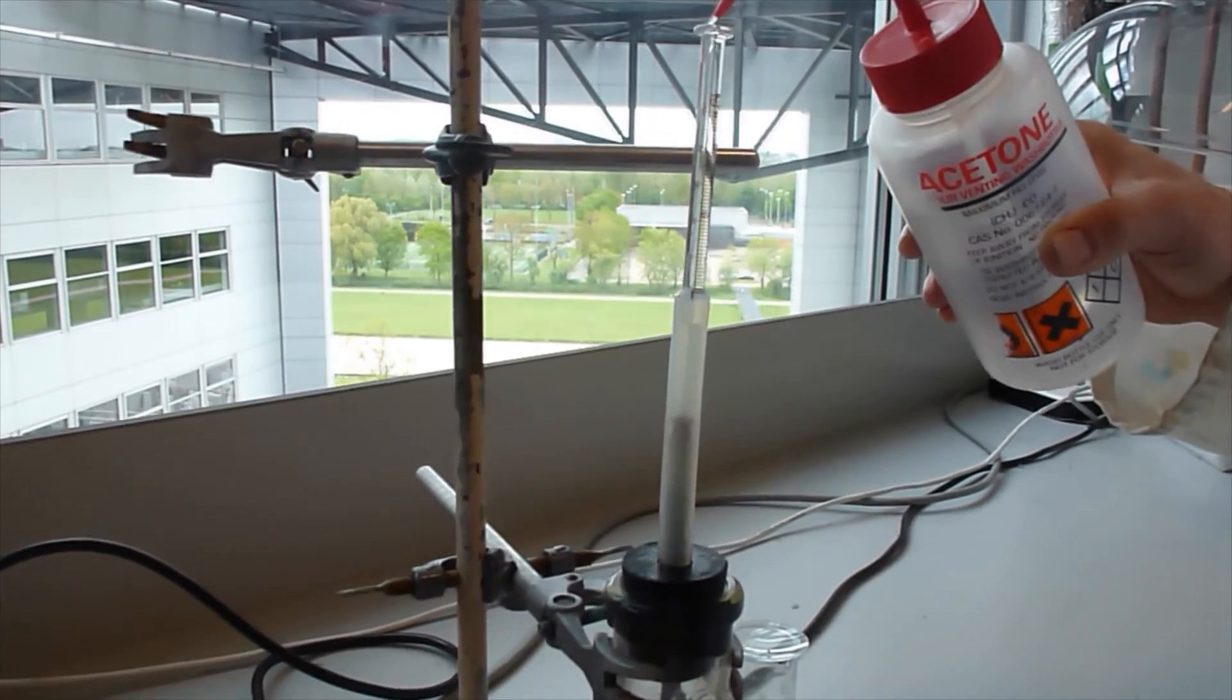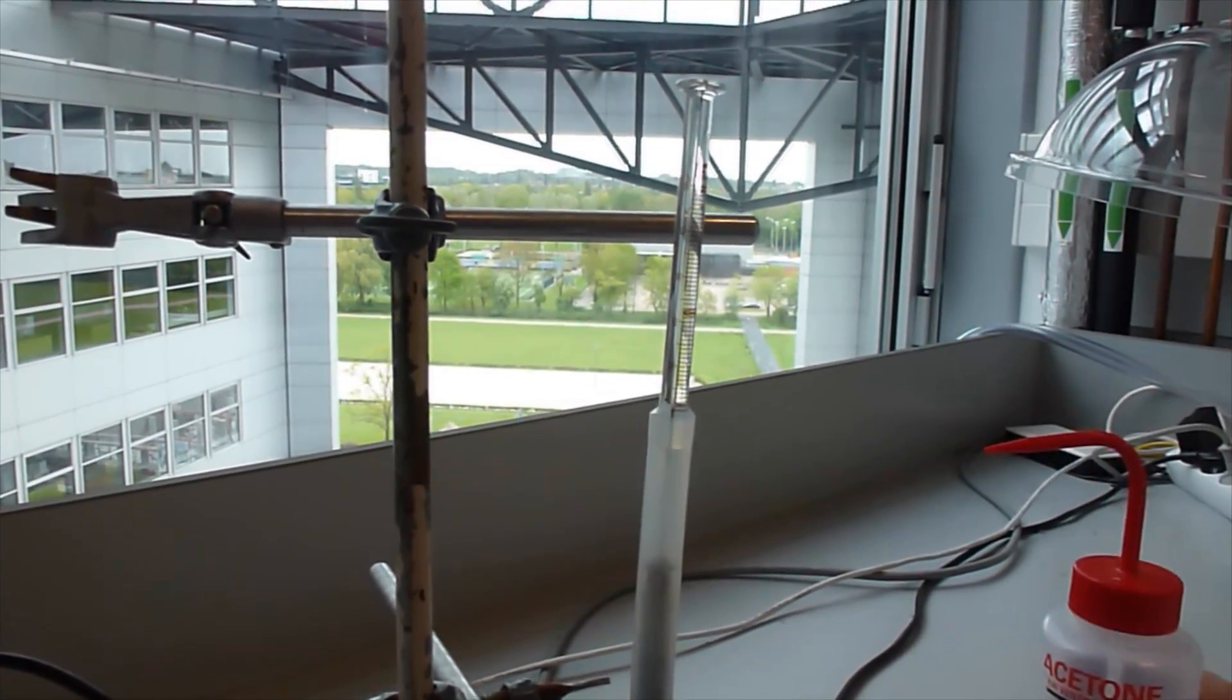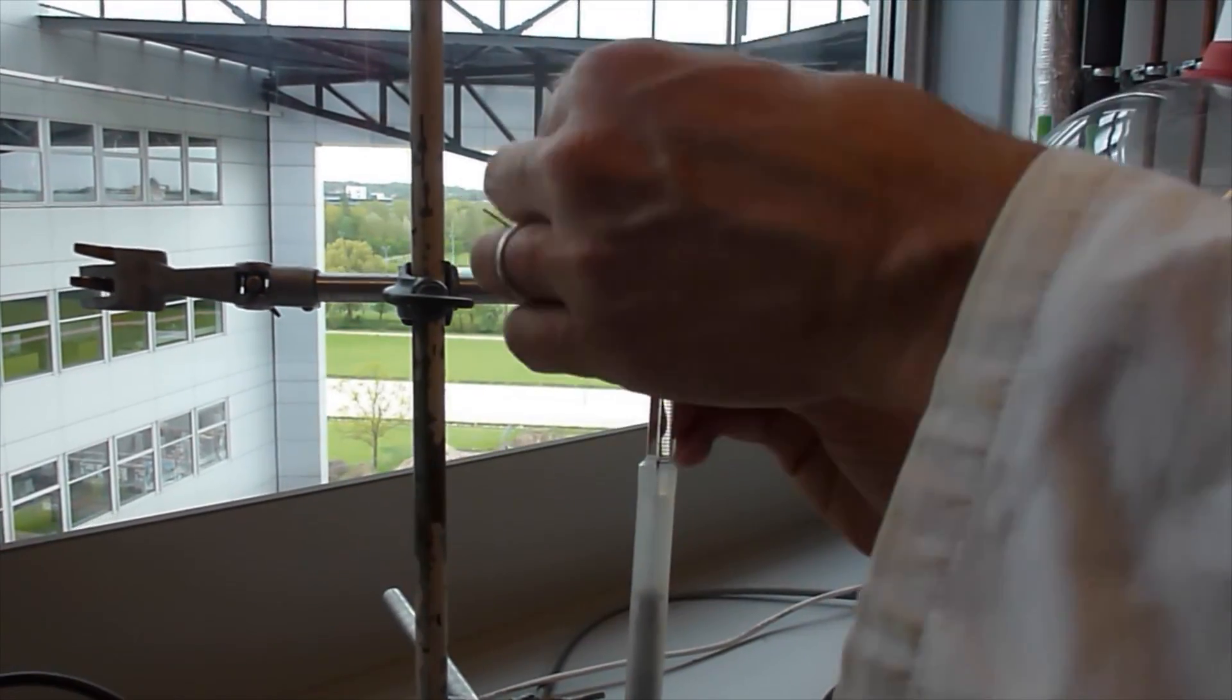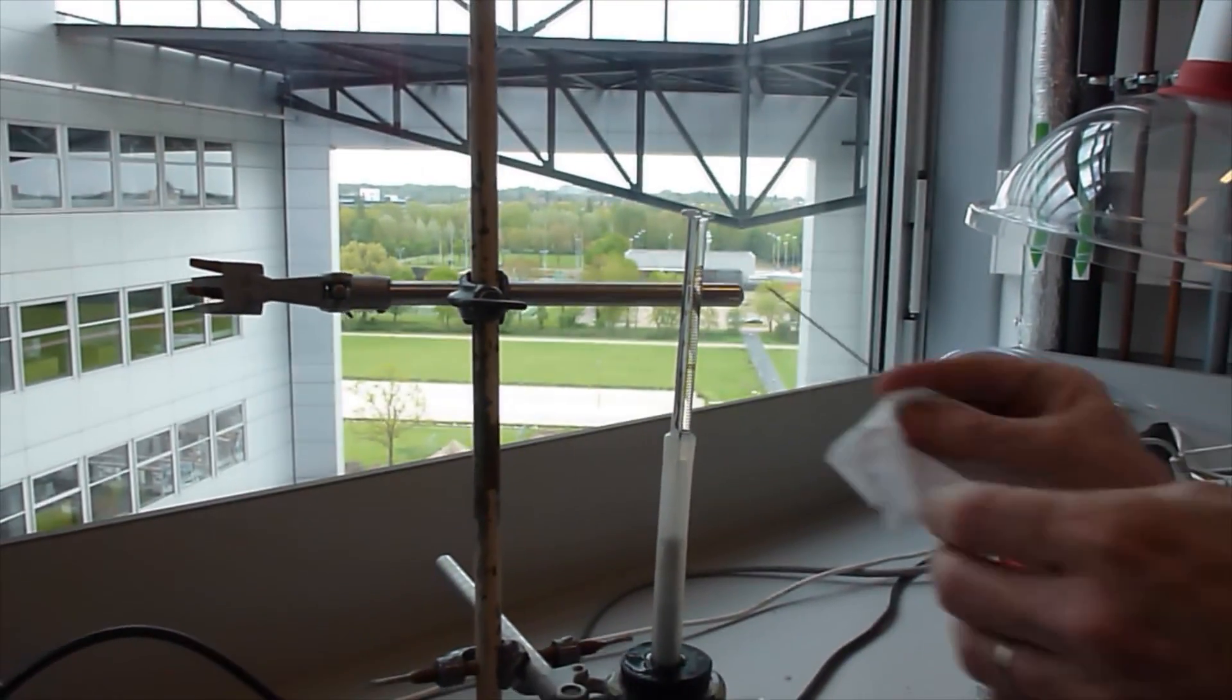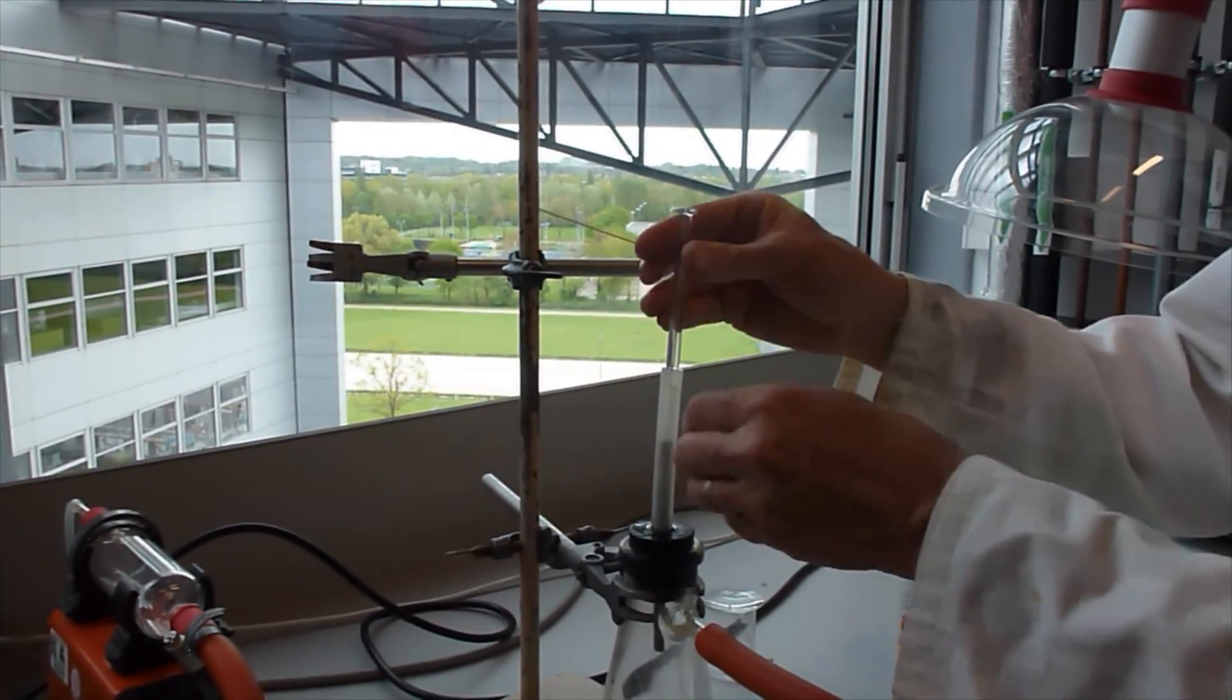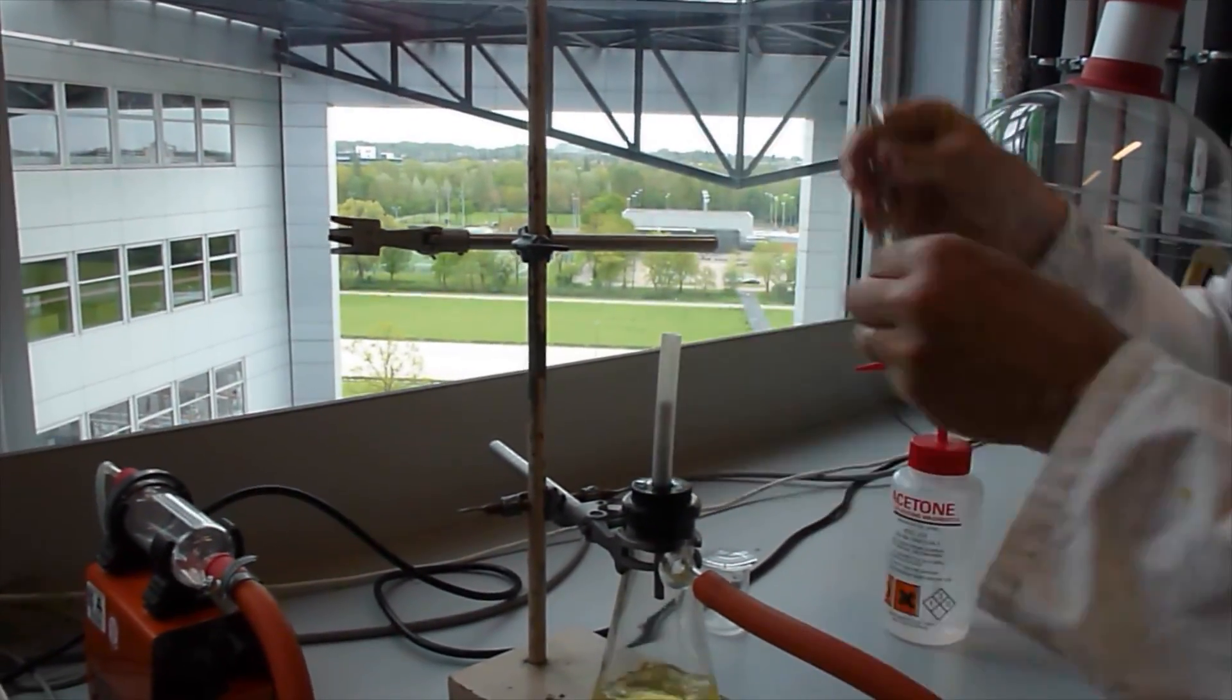Add a few drops of acetone on top of the syringe. Clean it at the top. Leave it for a short while to make sure that all the acetone has evaporated. And take it out.